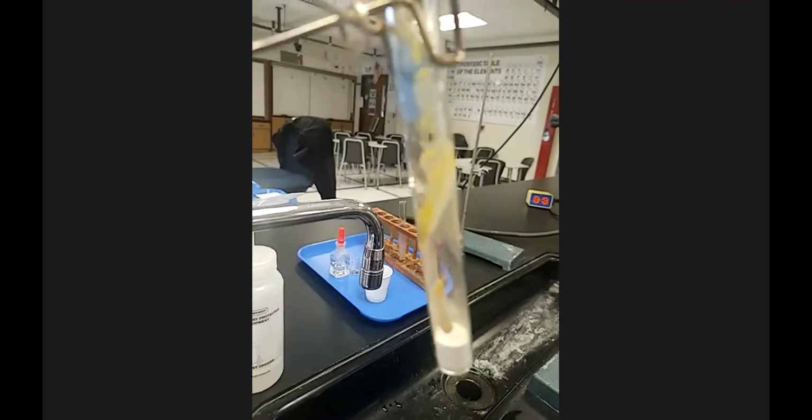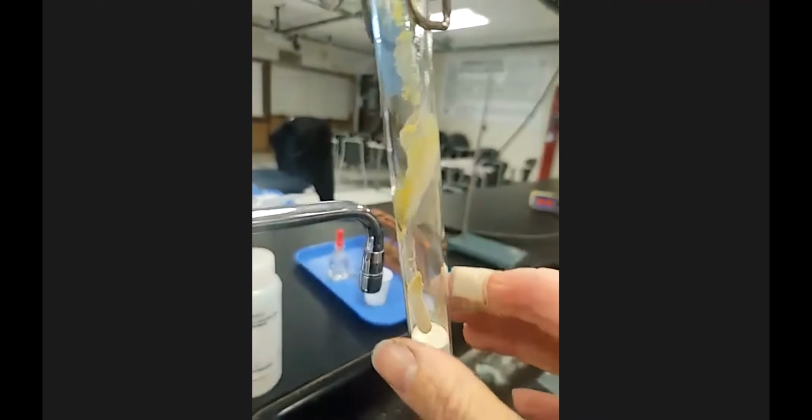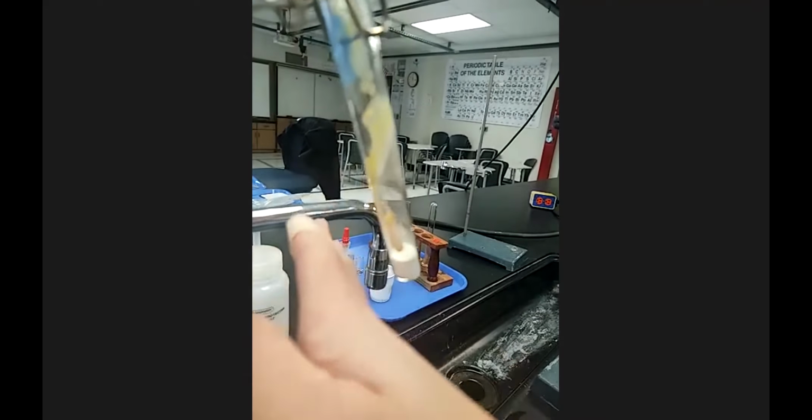Now, if you're trying to see if it is cool enough to clean, you don't ever want to grab it, because hot glass looks the same as cold glass. You don't ever want to grab it with the front of your hand. You always want to approach glassware with the back of your hand, because the back of your hand is much more sensitive to heat. If you can feel it radiating heat with the back of your hand, then you don't want to touch it. Then you could gently tap it with the back of your hand.